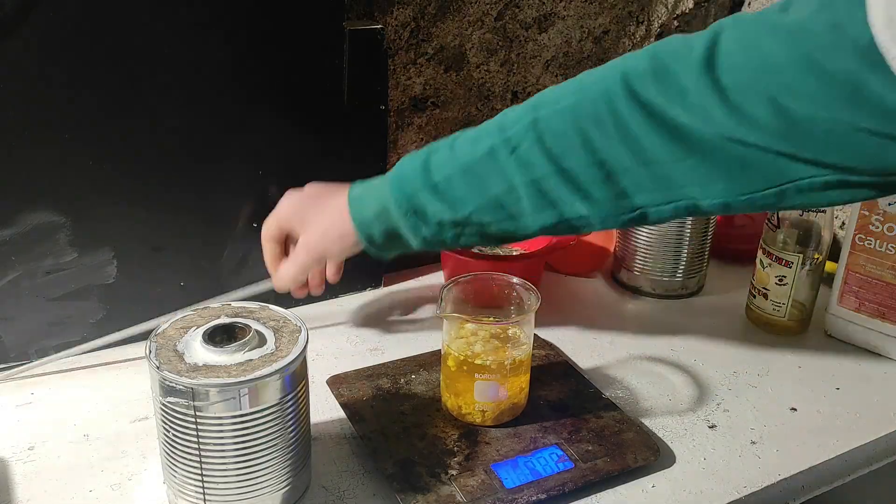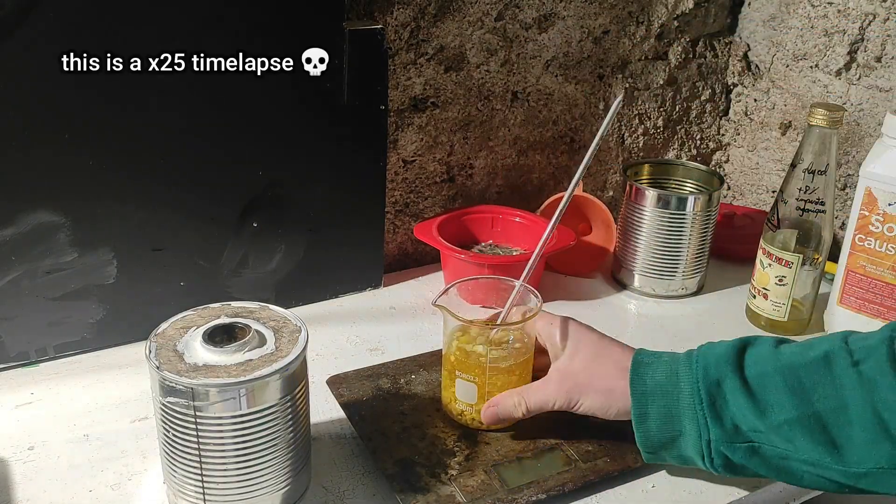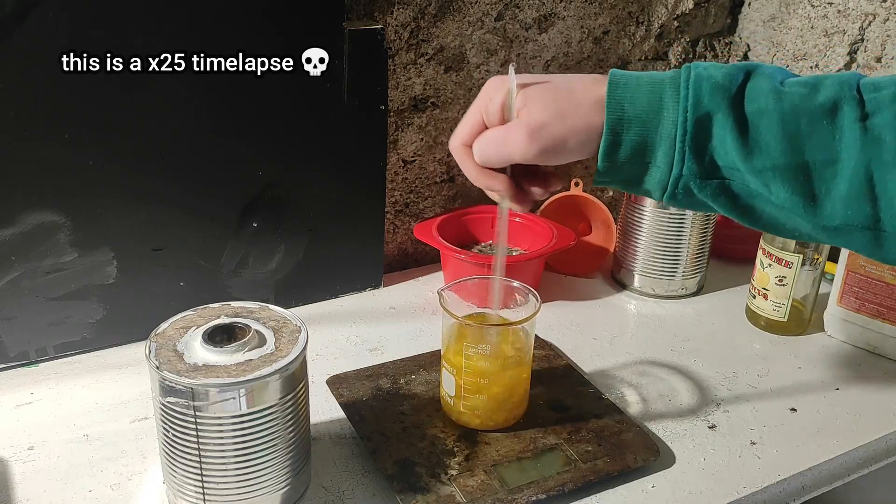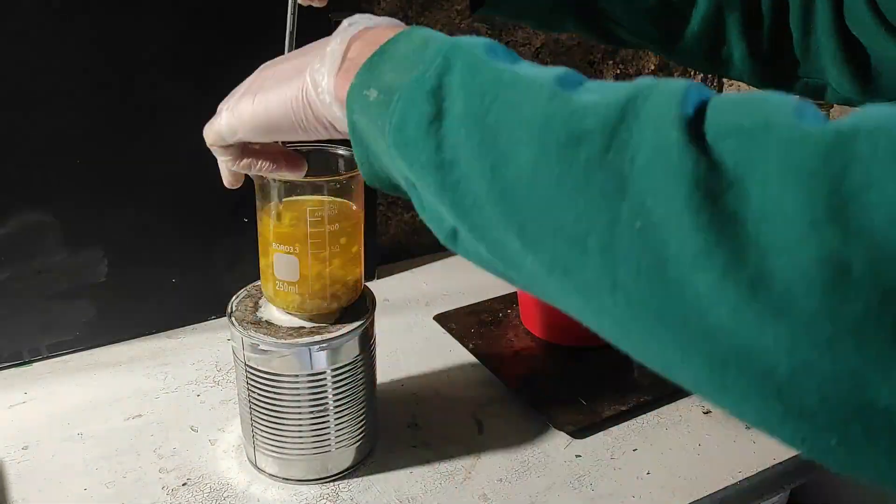After adding all of the ethylene glycol, I tried mixing it for a very long time as well, but it never fully dissolved, so I decided to just pour it in, as it will probably dissolve when heating.